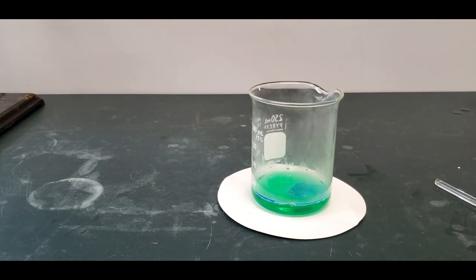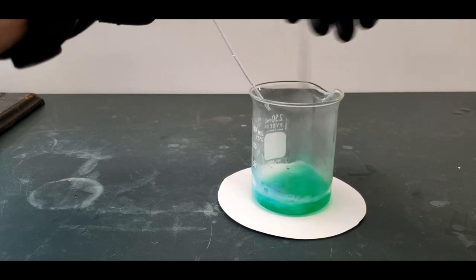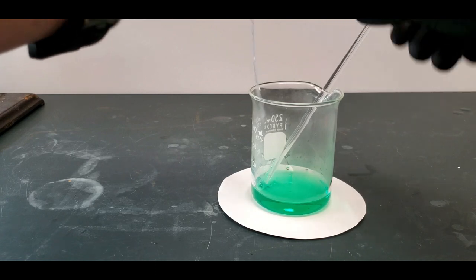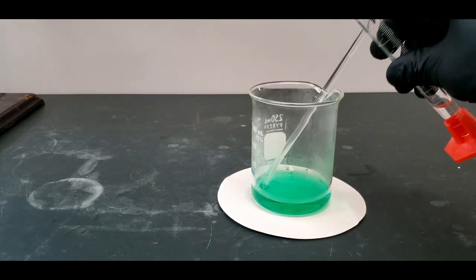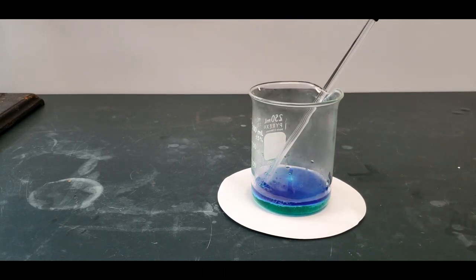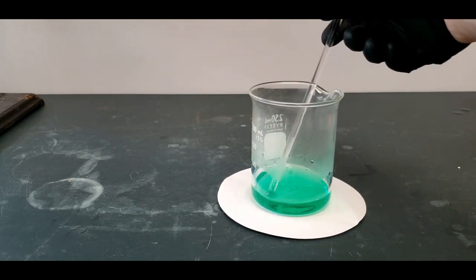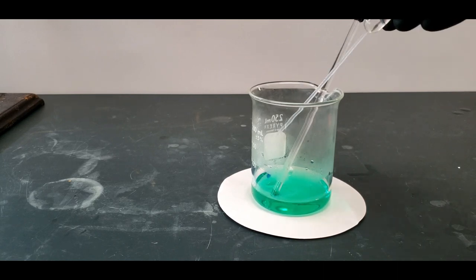They say you should stir as you go. You can see some copper hydroxide is forming, that blue, and that's supposed to happen. But if we keep going, let's put in the rest of this. Once we have enough ammonia, you can see that we still have a little ways to go, but that's the final form, final product we're after.